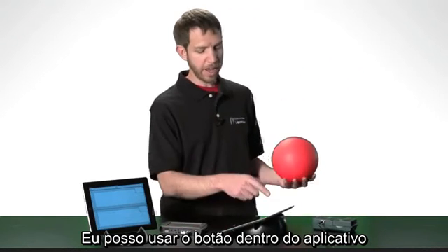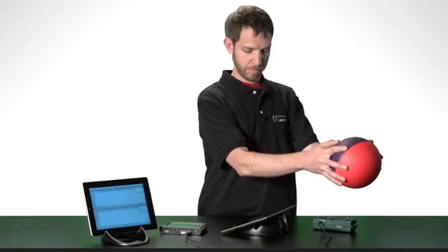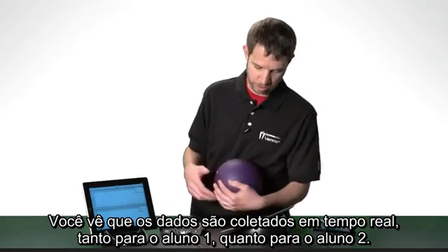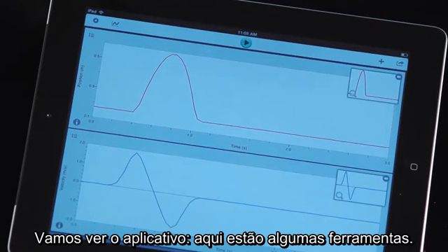I can use the button here inside the app to start and stop data collection. I'm going to go ahead and start this. And you can see that the data are collected in real time, both for student 1 and for student 2. Now each individual student can go ahead and do their own analysis. So let's take a closer look at the app.